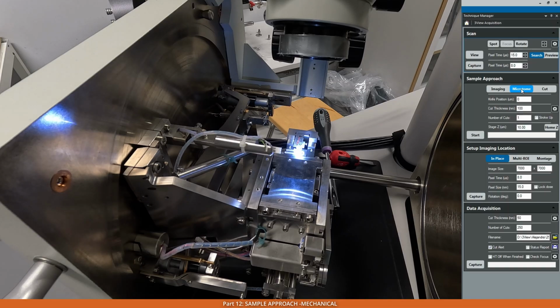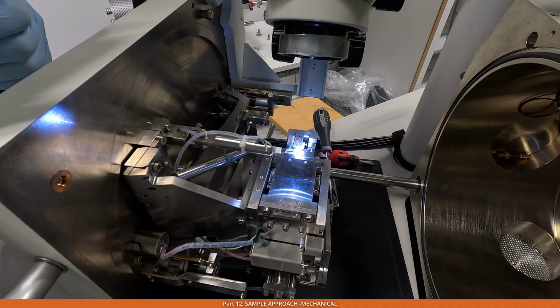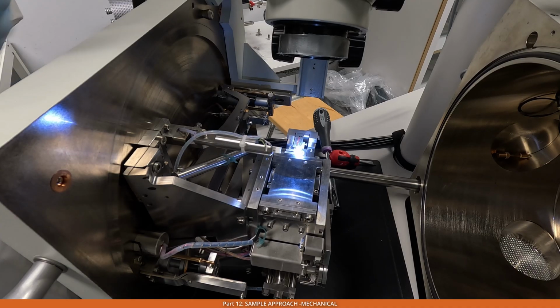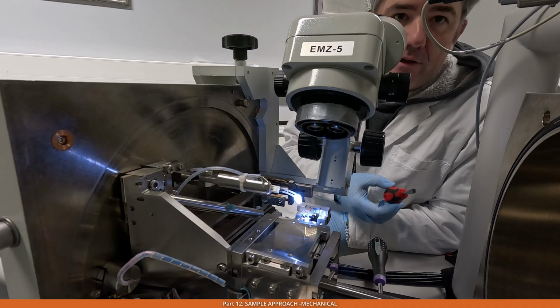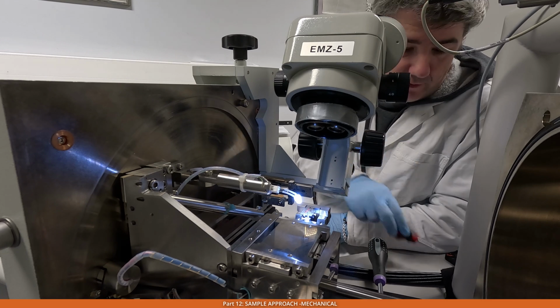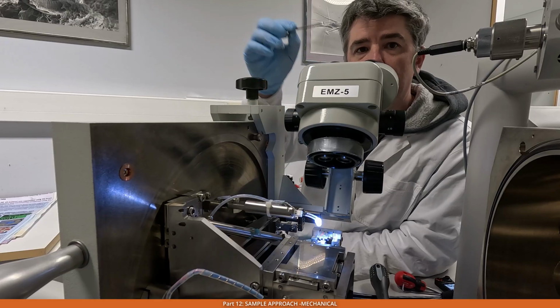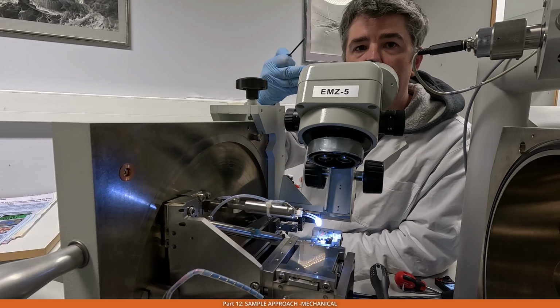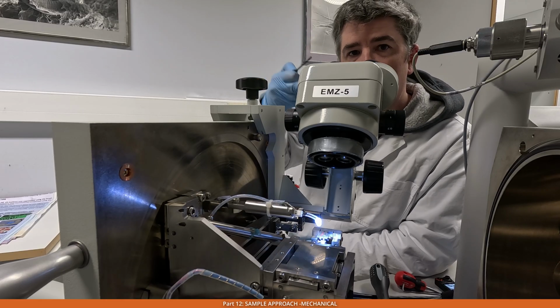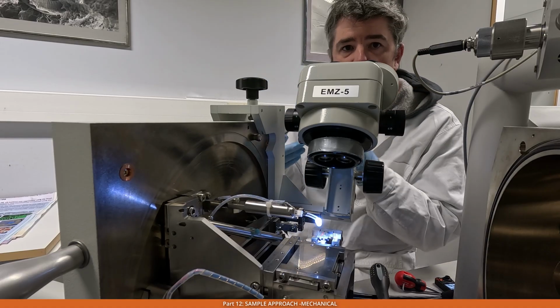Then we can press microtome again to return it back into the microtome position, which is just before it is doing the cut. When we have got as close as possible using the screwdriver, now we need to check that the knife travels all the way through the block face. We need to make sure that the knife edge is before the block, that when we do the cut it covers all the way through the block, and that when it tracks back, the path of the knife is still larger than the block face.